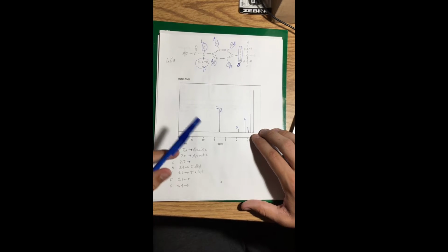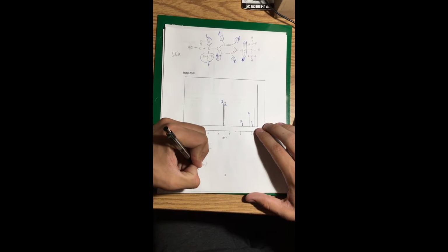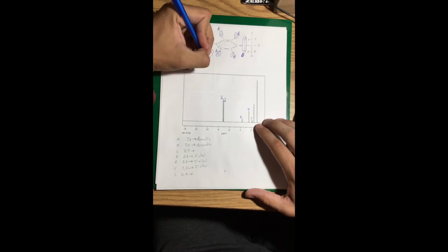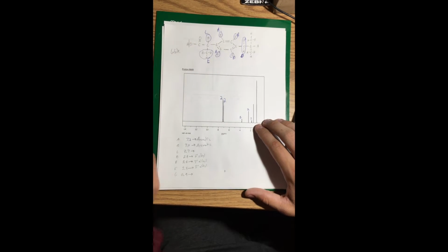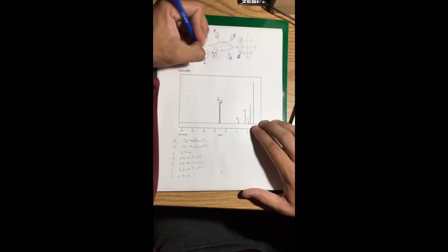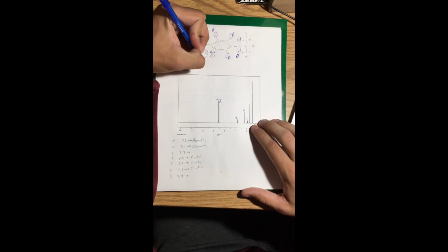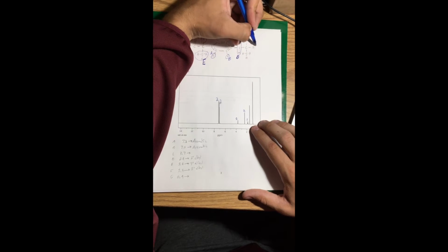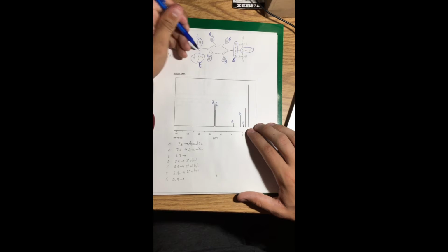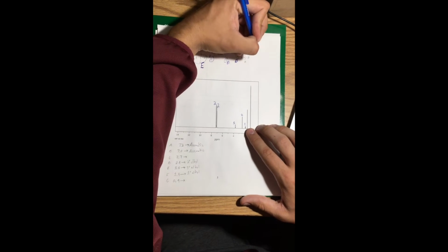Next line is at 1.4, and here it applies for a primary alkyl, so I'll write that down. Actually, I need to label this E. Don't know my alphabet. So actually, this is F. Sorry. The E actually applies over here. This is the tertiary alkyl. This is the primary alkyl because it is only attached to 1 carbon. This one is attached to 3. So this one will be E.